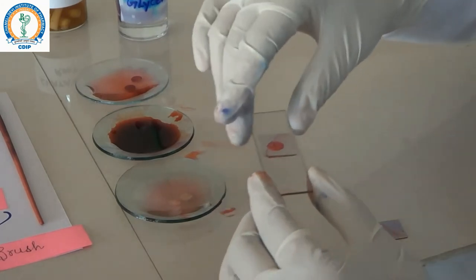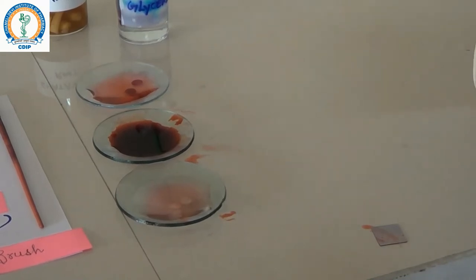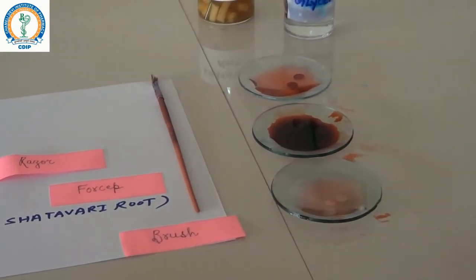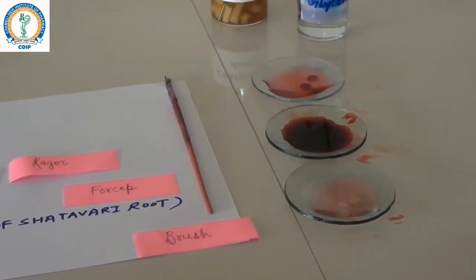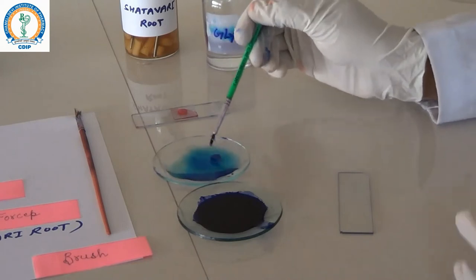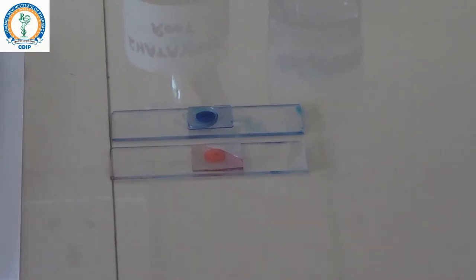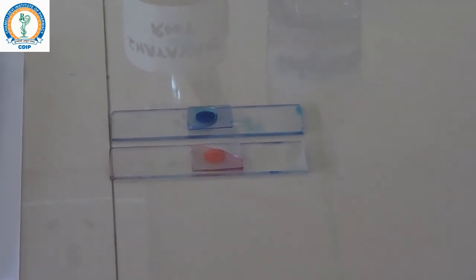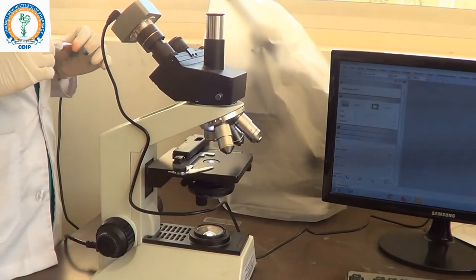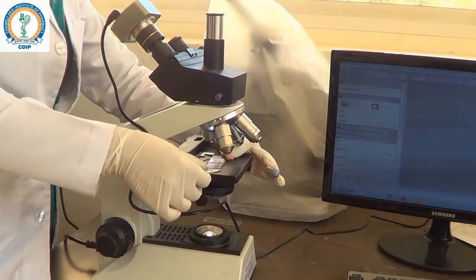After that, we will observe this slide under a trinocular microscope for resolution of the image. We will also prepare one more slide using methylene blue dye. You can now see both slides — one stained with safranine dye and the other with methylene blue dye — and we will observe them under the trinocular microscope.